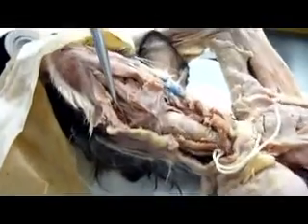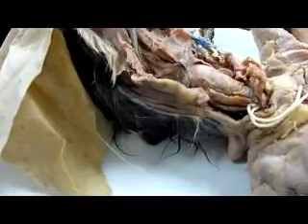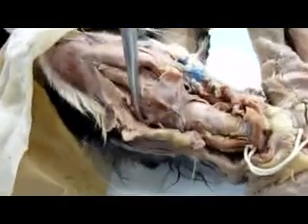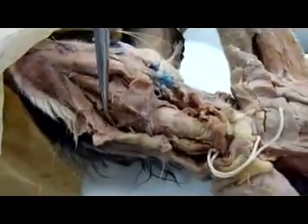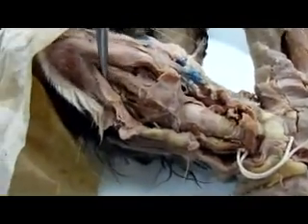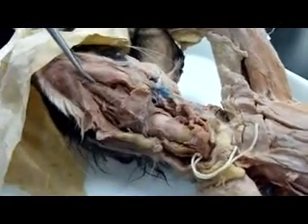Genioglossus. Underneath it, right? This right here is hyoglossus. And then the one that goes up like that is the styloglossus. Because we can't see it on here. Geniohyoid, hyoglossus.